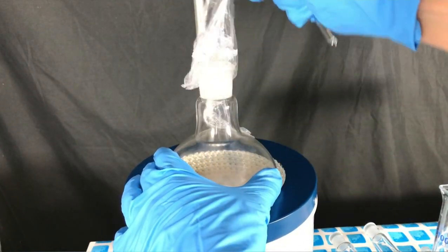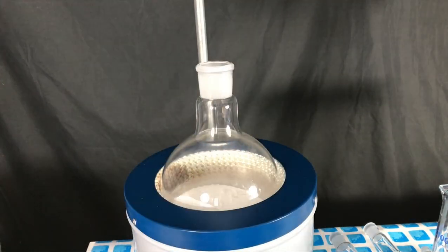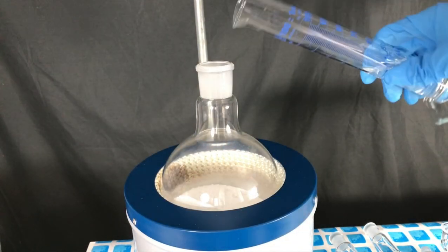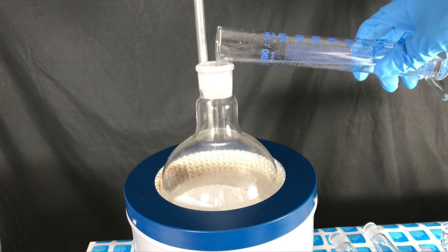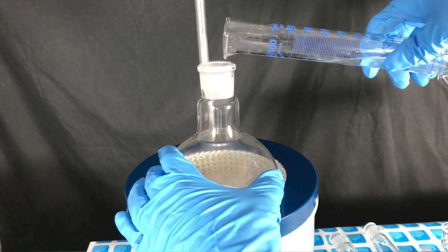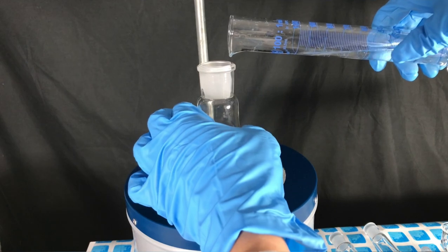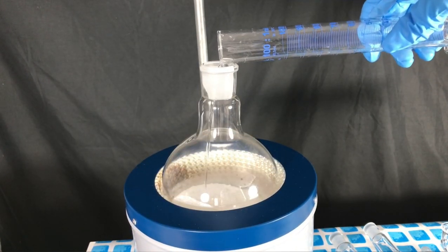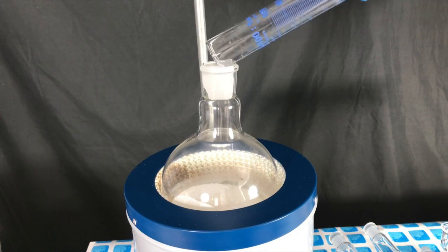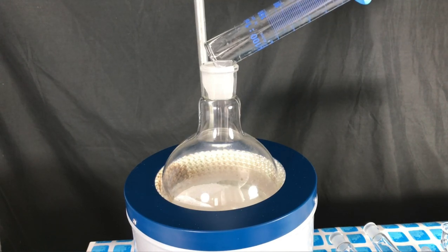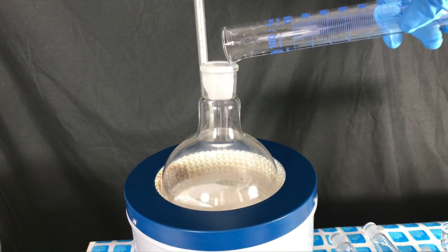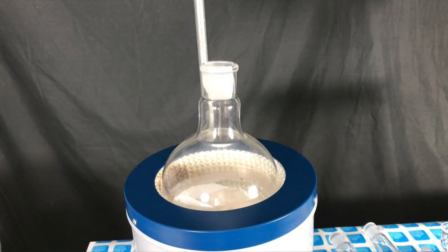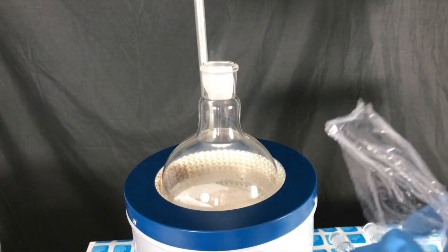Every time phosphorus pentoxide is exposed to the open air you should do whatever you want to do quickly because phosphorus pentoxide will suck up moisture. But while adding the sulfuric acid this wasn't the case because we had to add the sulfuric acid slowly. I didn't know what would happen and how exothermic this reaction would be. The reaction wasn't at all violent but still sulfur trioxide vapors directly became visible.